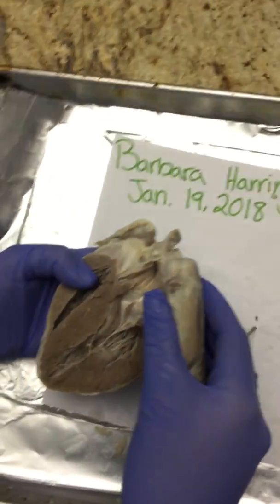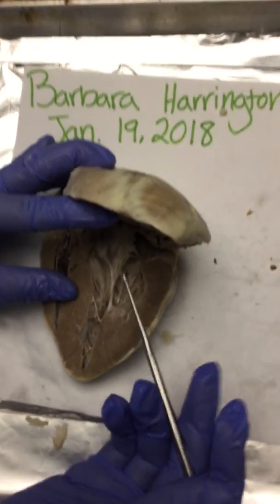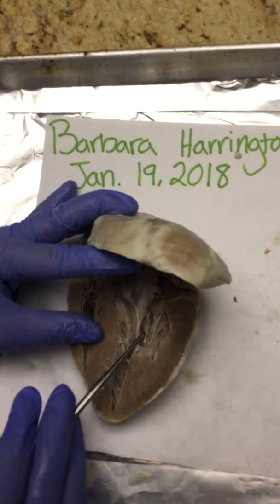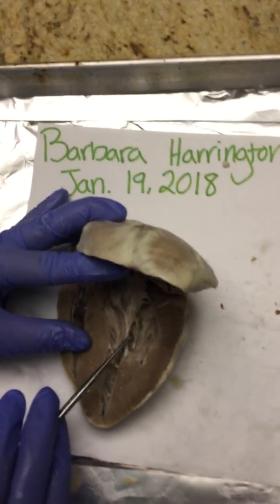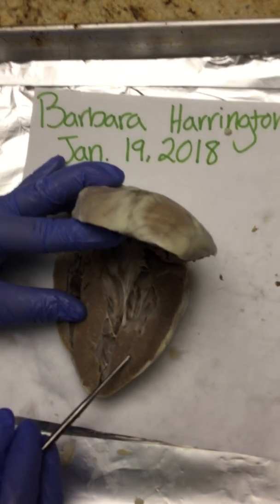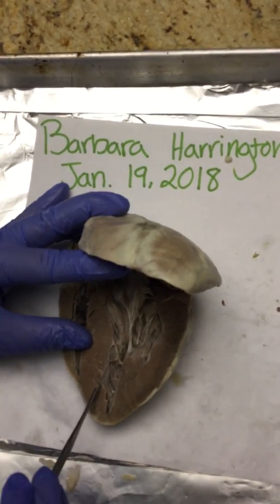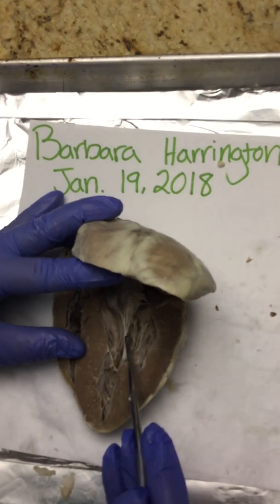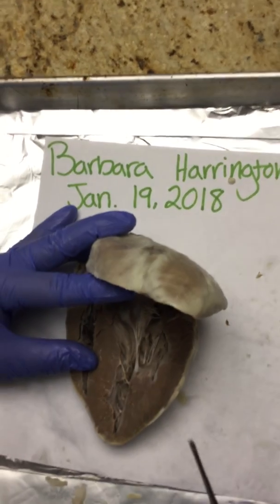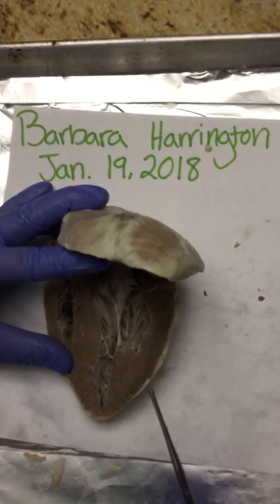And then when we open up the heart, it's pretty neat, we can see a lot of different structures in here. So this right here is our tricuspid valve, and whenever we think of tricuspid, we need to relate it to the right side of the heart. So this is the right atrium, this is the right ventricle, this right here is our interventricular septum, and again, this is the tricuspid valve, which has papillary muscles attached to it and chordae tendineae, so it's just these tendon-looking structures in the heart.